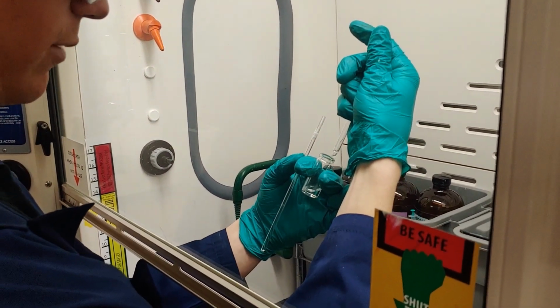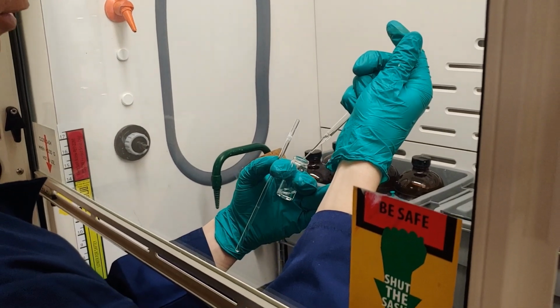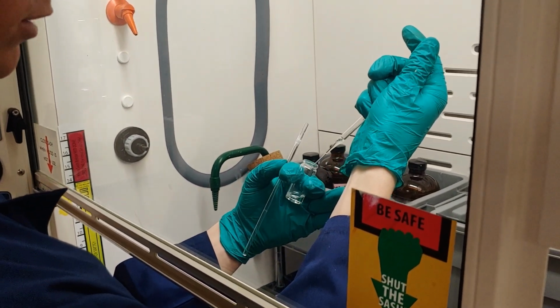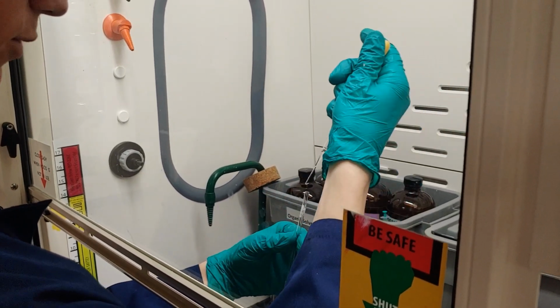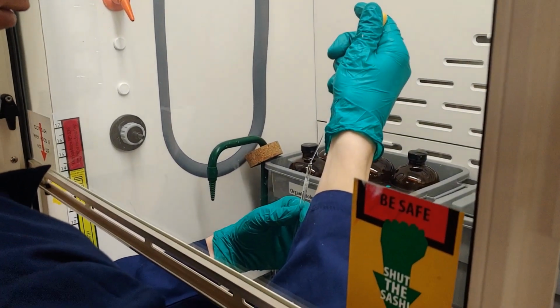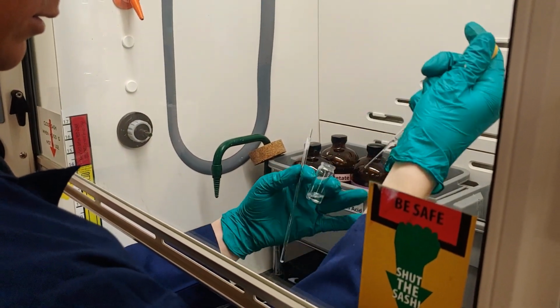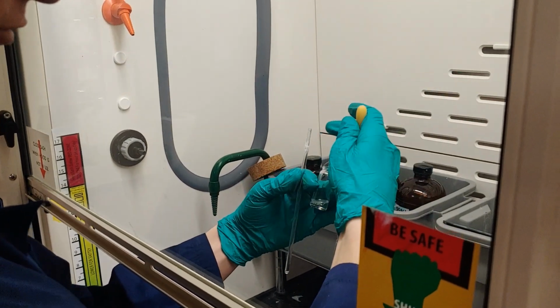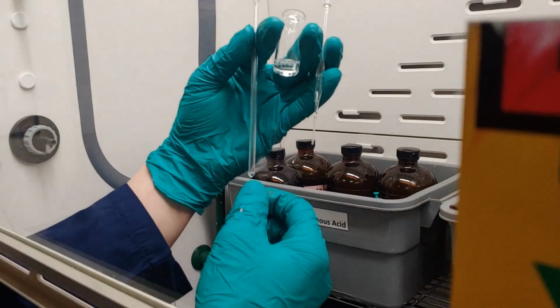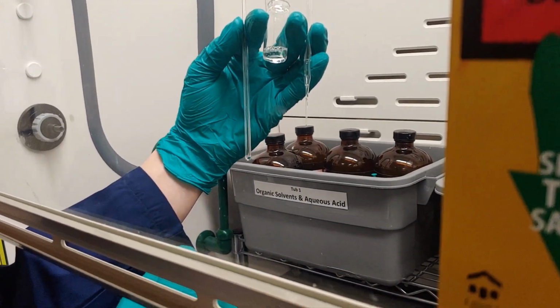So now I have my clean NMR tube, so I'm ready to add some product. Typically, we'd recommend about 10 milligrams of product. Whenever you're dealing with a liquid solution, though, you should use roughly 2 to 3 drops. So once that goes to the bottom, you'll see that it's roughly about the same amount of solid material that you would normally use, in that it goes just above the curvature of the NMR tube.